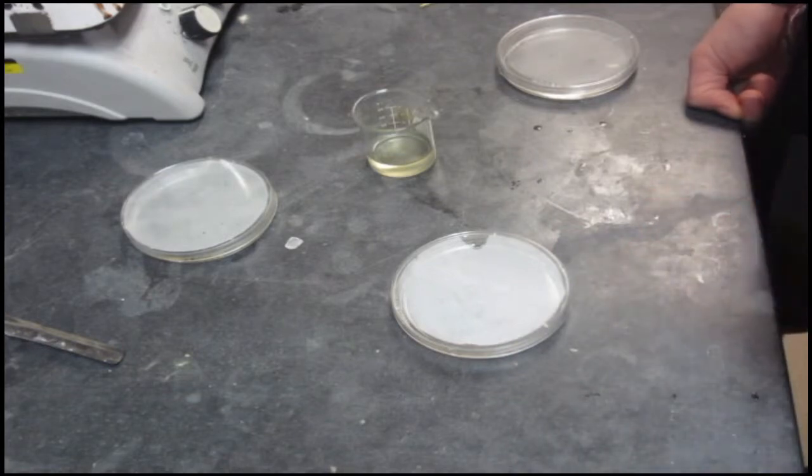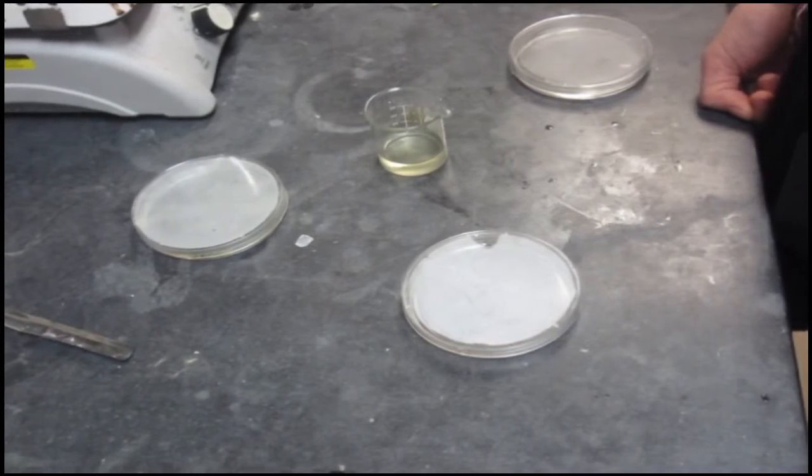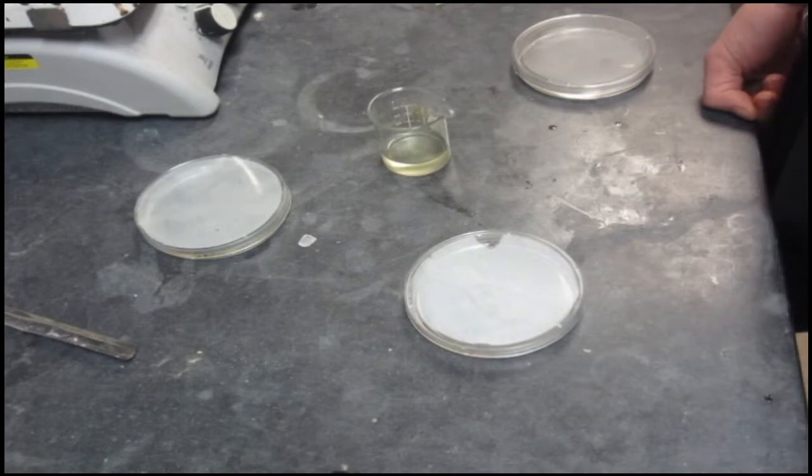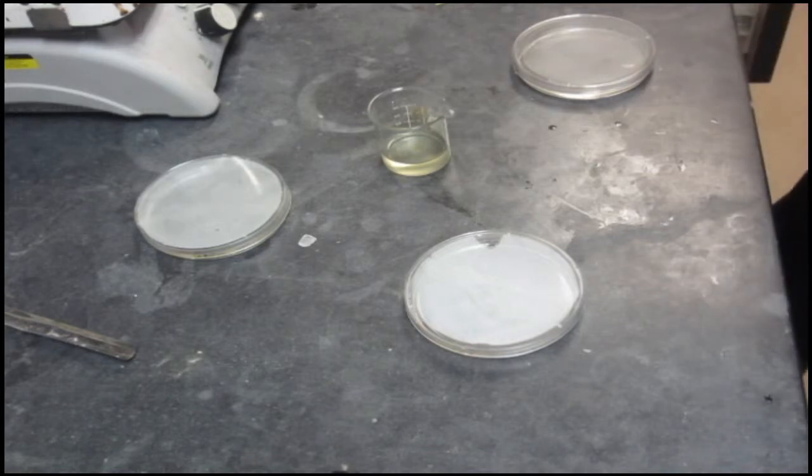Then you'll wait a couple of days. When you get your bacterial colonies, then you can do whatever you will with them. Count them, look at percentage coverage, you could stain them if you want. All the different possibilities. So I hope that helps. That is our process of how we are going to create some agar so that we can do some experiments with bacteria. Thanks students!